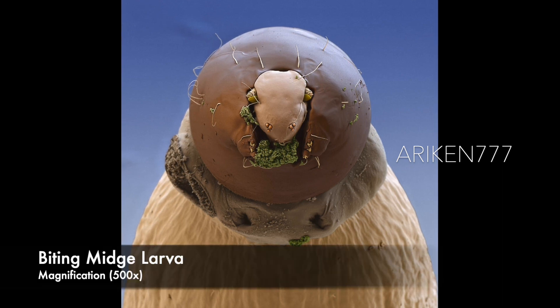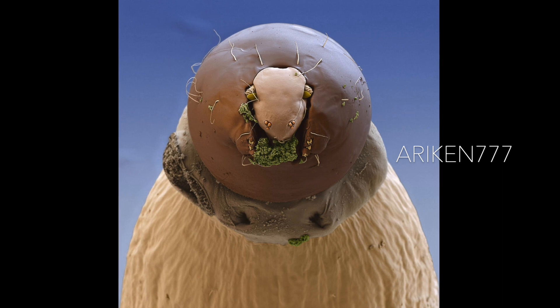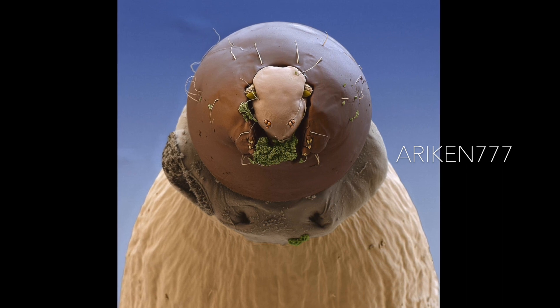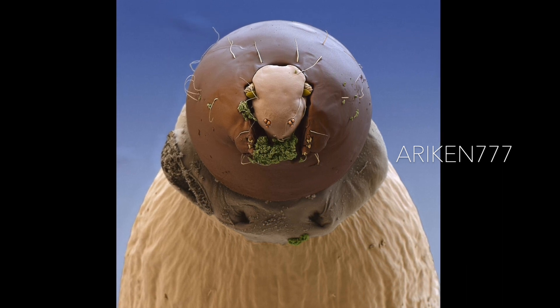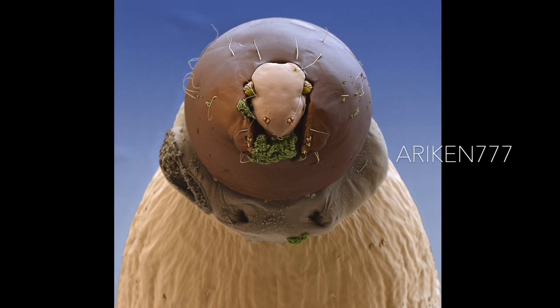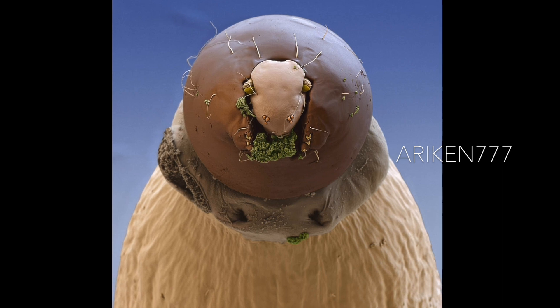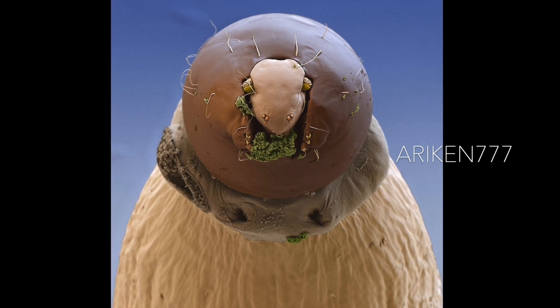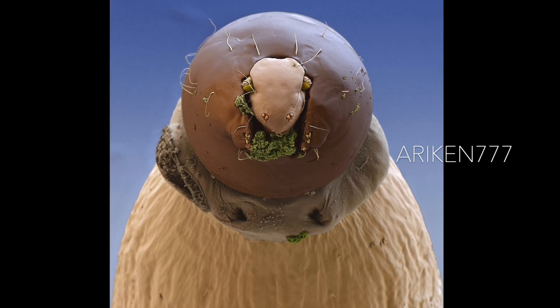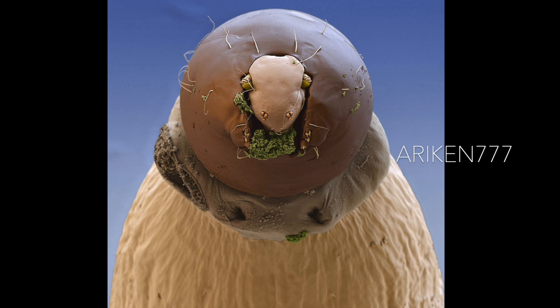The larvae of a biting midge — these are very small insects, only about two millimeters long. The adult males feed on plant juices, while the females suck the blood of birds and mammals.